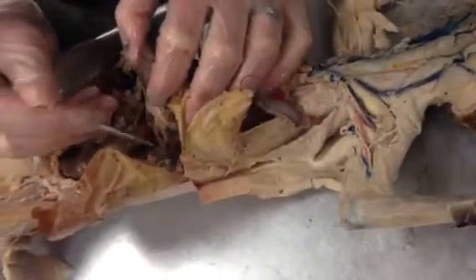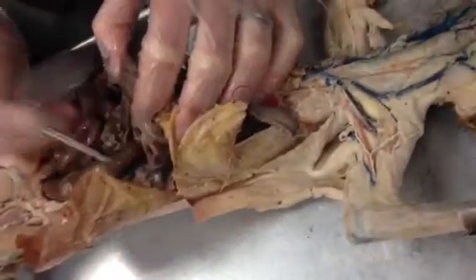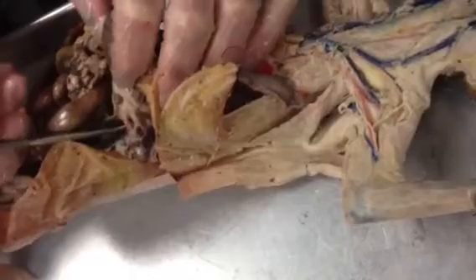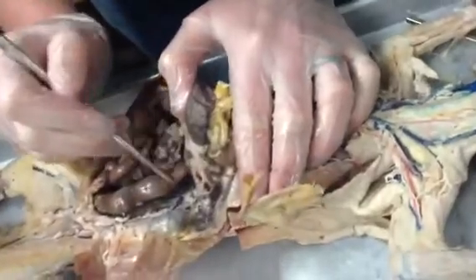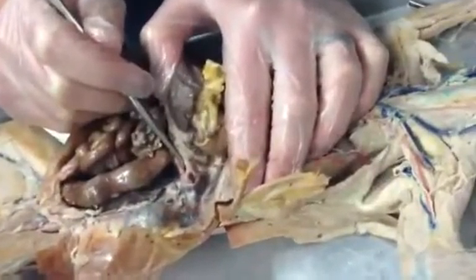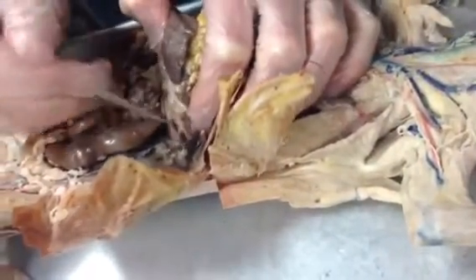That is a relatively broad artery. And so there's two main arteries right here. There's the celiac trunk, and then there's also the superior mesenteric artery right here, okay? So right here, and I'll pull these apart a little bit more, but here's the, I believe she calls it superior mesenteric artery. Yeah, superior mesenteric artery right there. And then this should be the celiac trunk right here, okay?